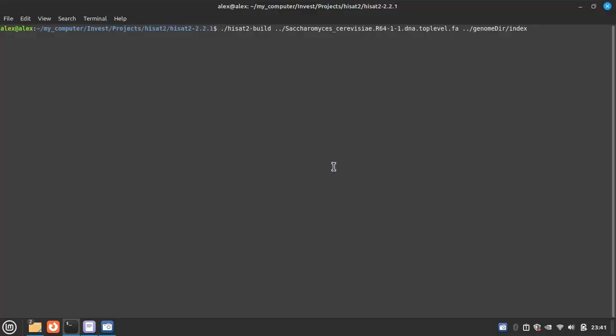So here I am trying to run the HISAT2 build HISAT2 tool. So I am facing a problem, right? Here it is showing that there is no Python. So let's check it.